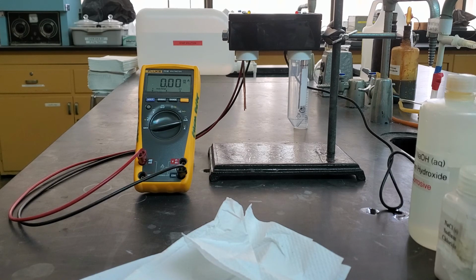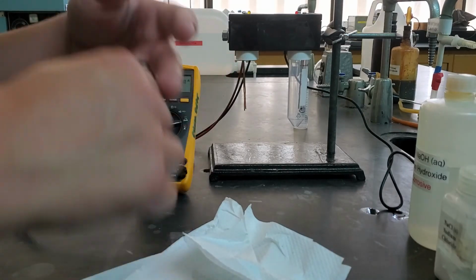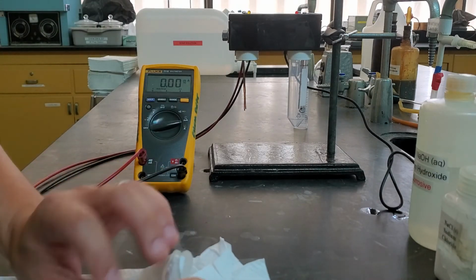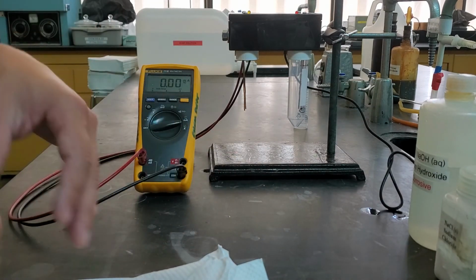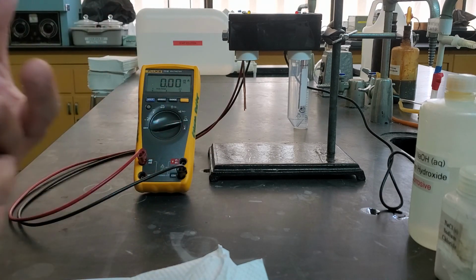And so that's all we need for table number 1. So we have our conductivities. Now what you want to do is classify them as whether they had no ions, a few ions, or many ions. It's up to you to make that decision about where you might classify things as many, where you might classify them as a few, and where you might classify them as no ions. So look at your values and try to categorize them into those 3 points. You can see if any trends develop with that.